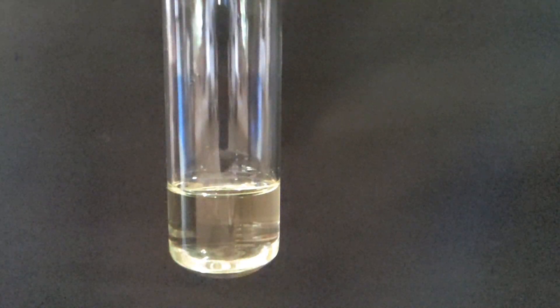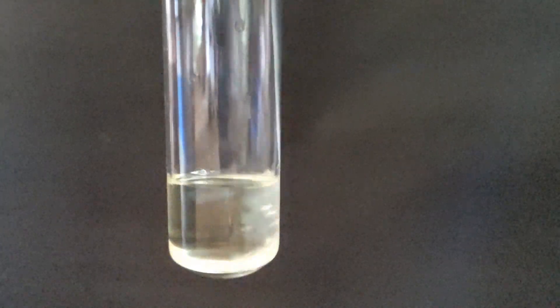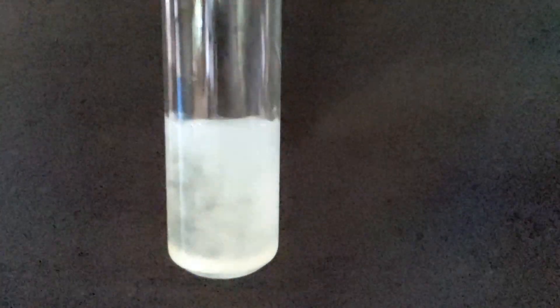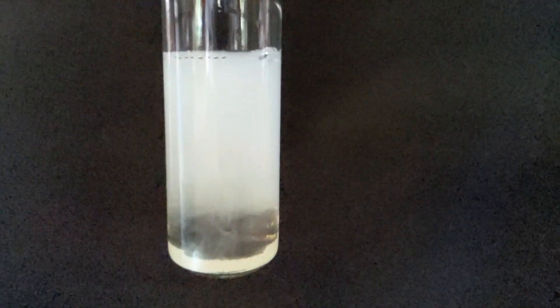Here is the clear solution of the dichloro-argentate complex. However, on dilution of this complex with water, the equilibrium shifts to the left and the precipitate of silver chloride will reappear.